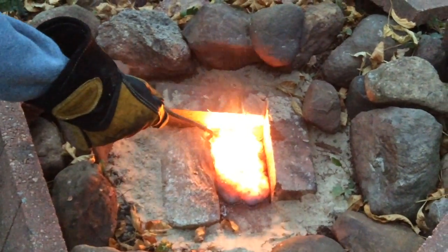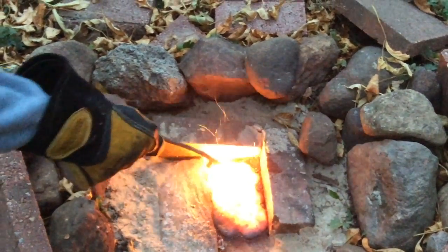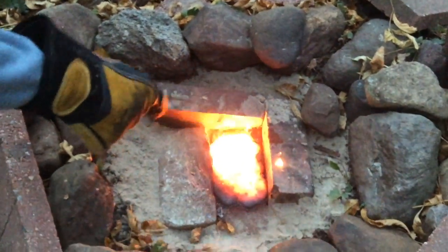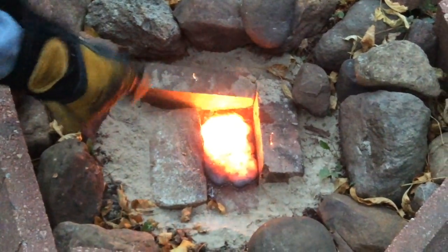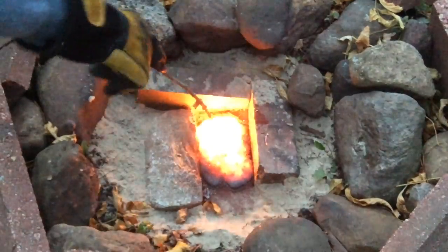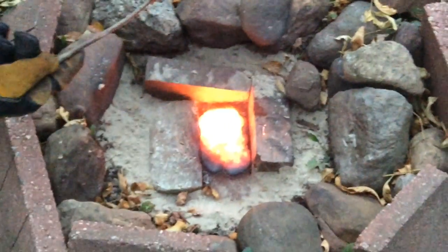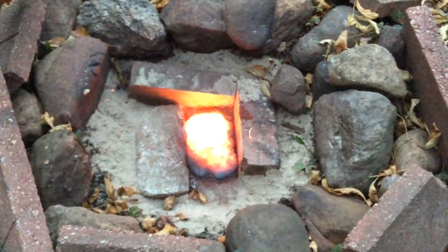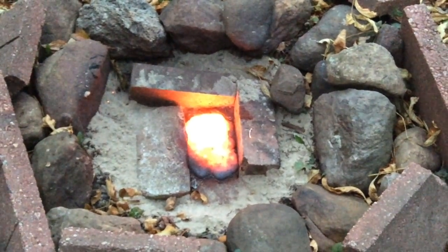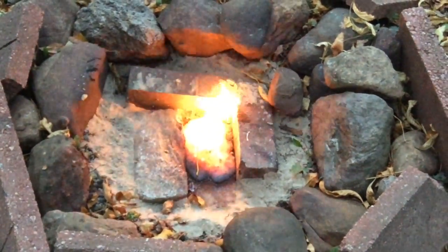So you do not want to mess with thermite. Look at that. That's just how hot it is. So this is molten iron and molten aluminum oxide. But this reaction got hot enough to melt. See what happens if you put a leaf on it. Look at that, instant flame.